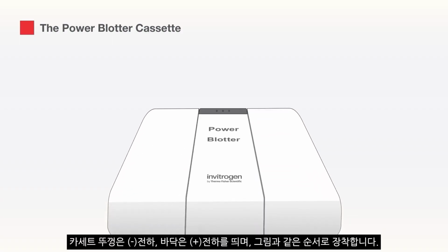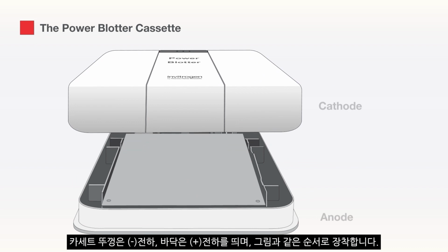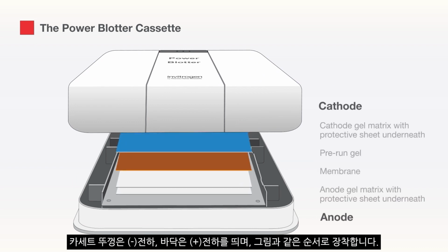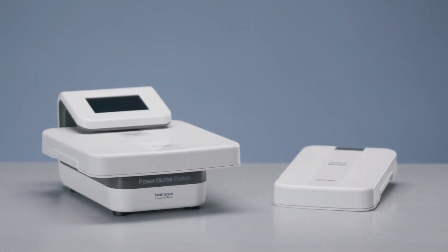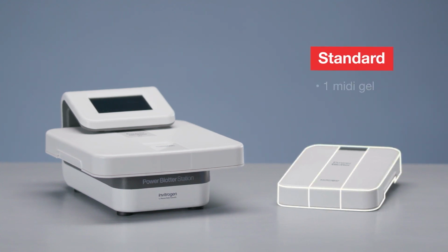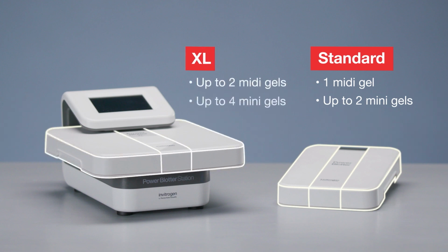In the Power Blotter system, the cathode and anodes are plates that are fixed to the top and bottom of the cassette frame respectively, and the transfer stack is placed in between the cassette during the transfer process. The Power Blotter has two different cassette sizes, a standard size for transferring one midi gel or up to 2 mini gels, or the XL cassette for transferring up to 2 midi gels or up to 4 mini gels at a time.